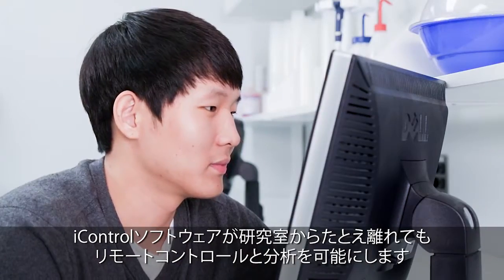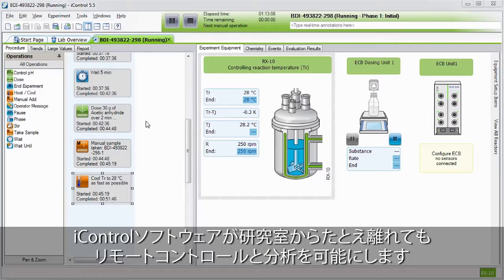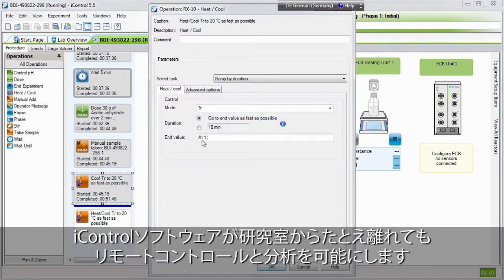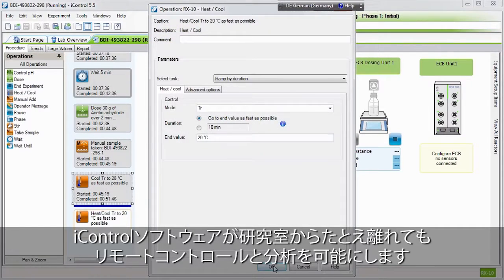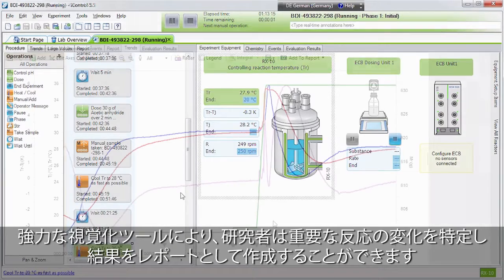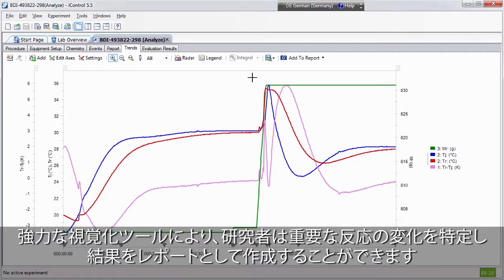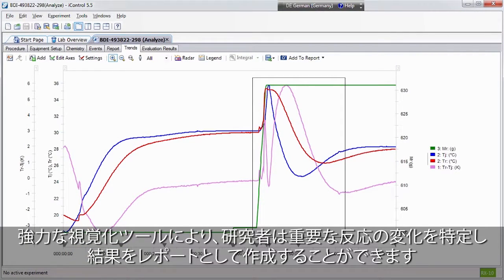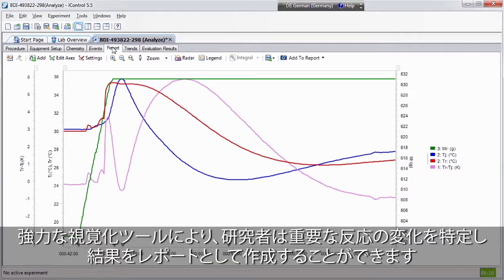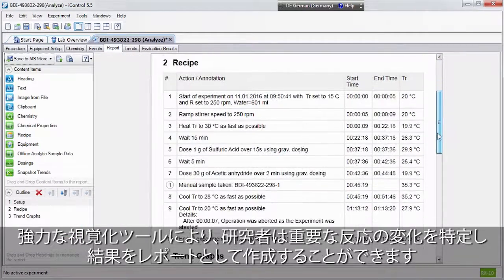When away from the lab, iControl software provides remote control and analysis. Powerful visualization tools allow chemists to identify key reaction events and develop reports to communicate findings.